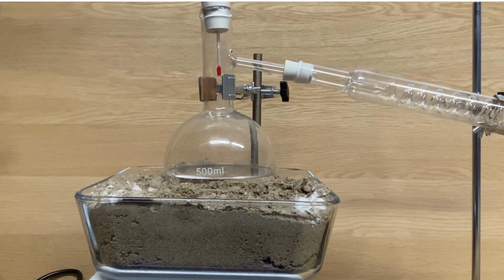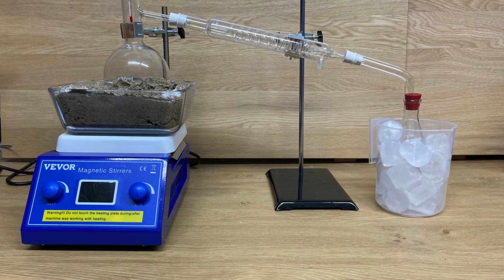The first step is to check the mass of the alcohol to see if it is indeed 70%. You do this by measuring the weight of the 100 milliliters of alcohol from the bottle that you purchased and divide it by 100. It turned out that it was actually much purer than the 70% that they said on the bottle. It was more along the lines of 80% pure. It is always good to check these things and to check your numbers to make sure that you are working with the correct numbers. After this, we put together a distillation apparatus.